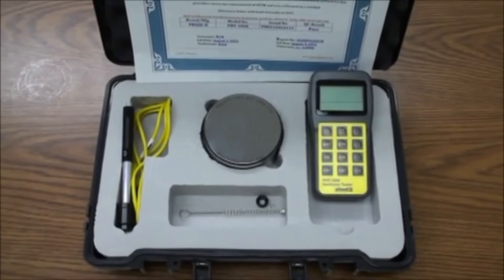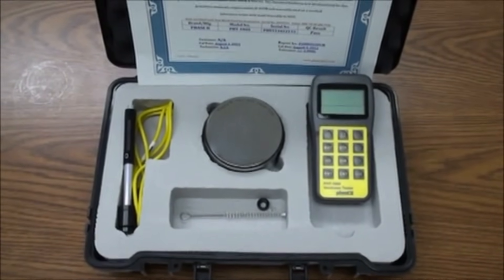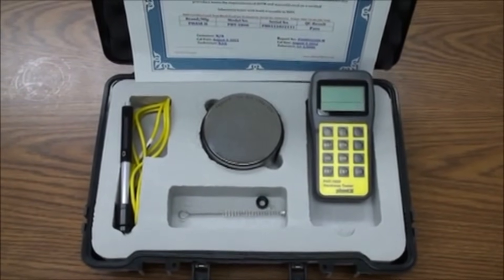This is an instructional video detailing the applications and functions of the Phase 2 PHT1800 Portable Hardness Tester.